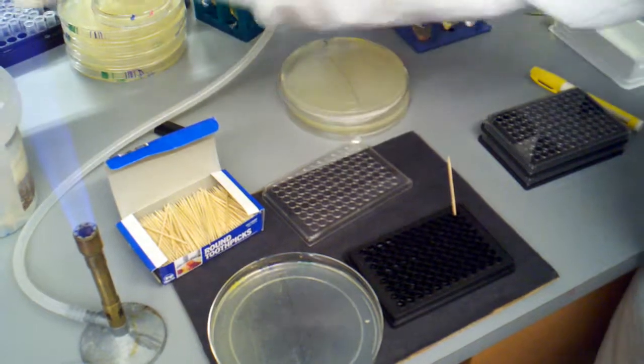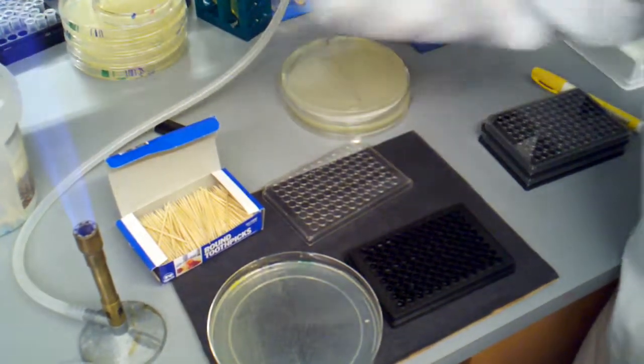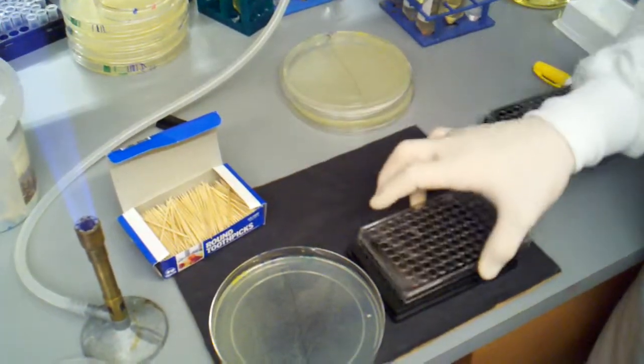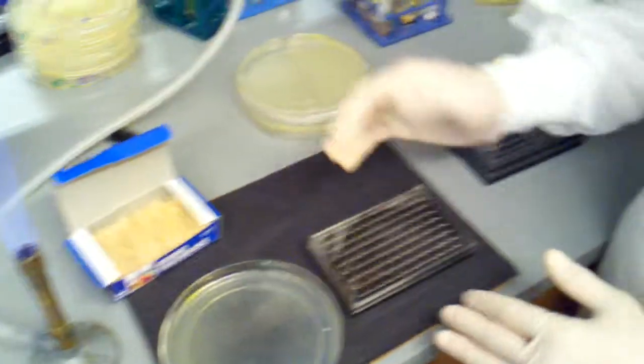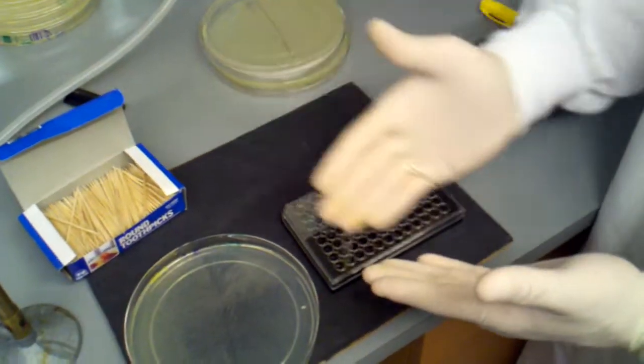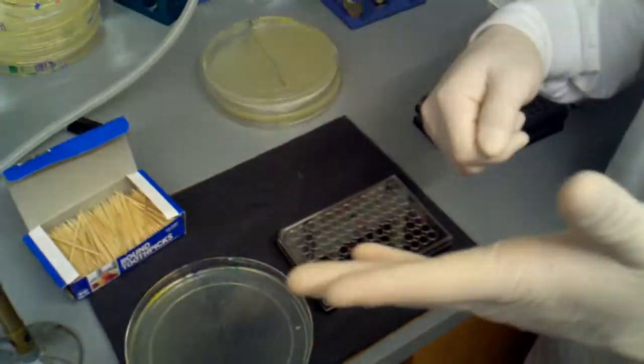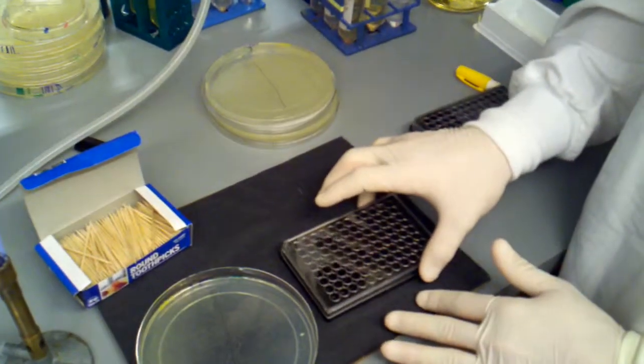After we pull out all of our toothpicks, you can even pull them out one at a time, we just cap it. We would wrap it in cellophane, tape it up, and throw it in the incubator. So we'll be back and we'll show you that step in a little bit.